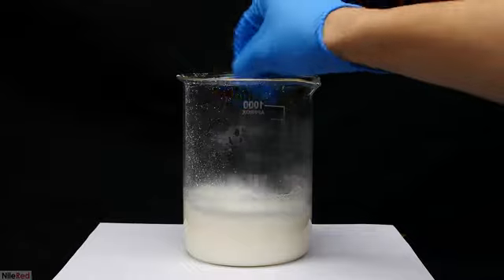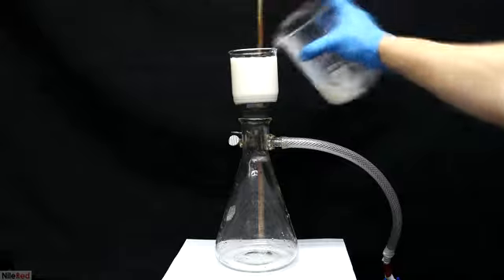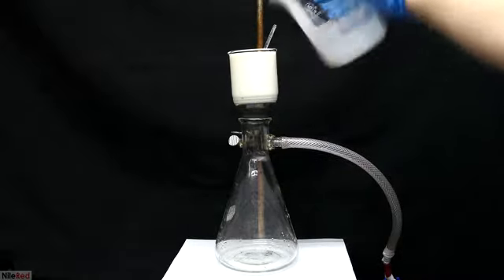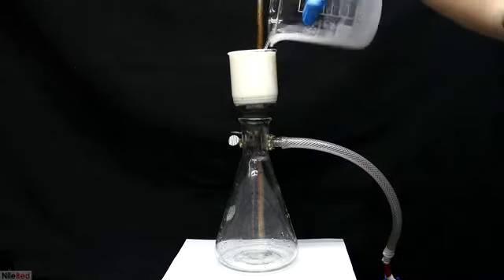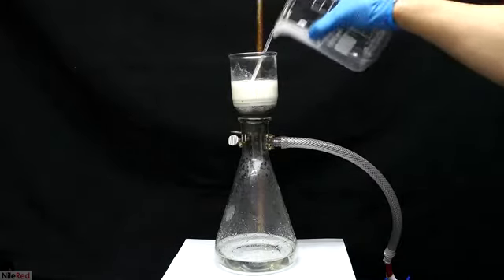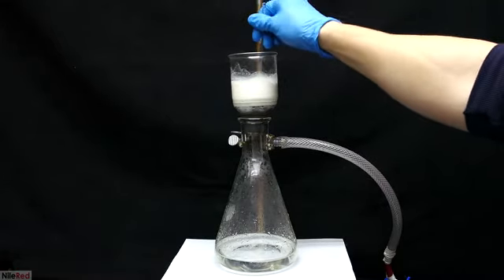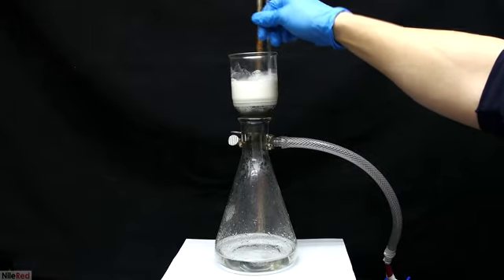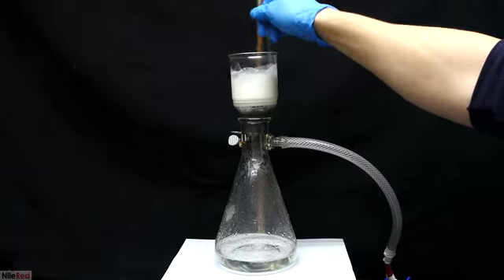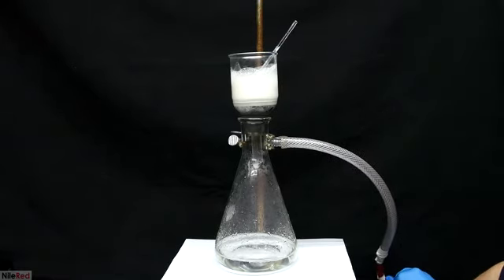I kept stirring it for several minutes to make sure that the reaction went to completion. I again went back to my trusty vacuum filter and I separated off the calcium sulfate. Even with the vacuum on full, the filtering process is kind of slow. Once everything comes through though, I use a little bit of water to wash the beaker, and then I add it to the filter. Using the stir rod, I mix things around to give the calcium sulfate a good wash. There might be some citric acid trapped in the calcium sulfate, and this can help to pull it out.